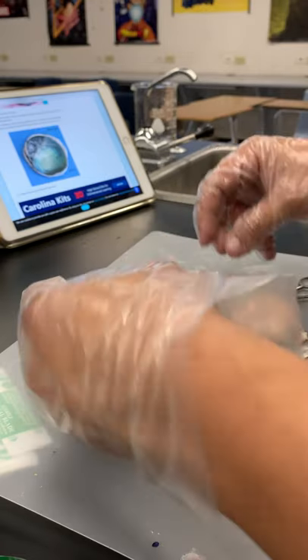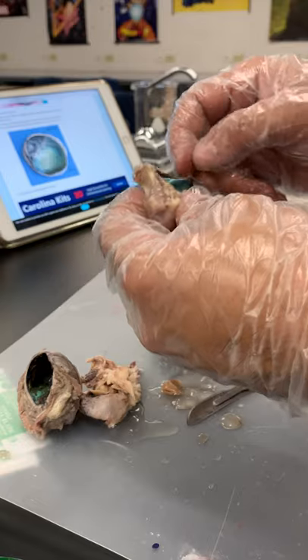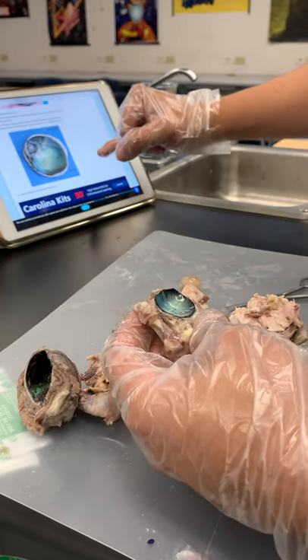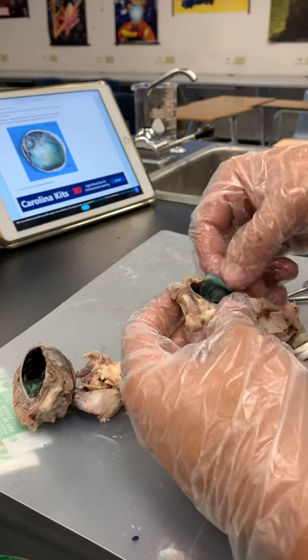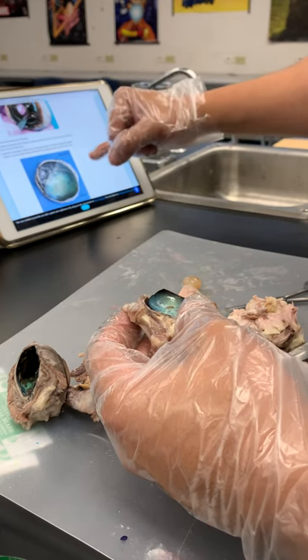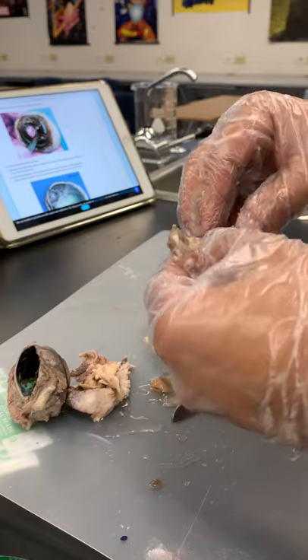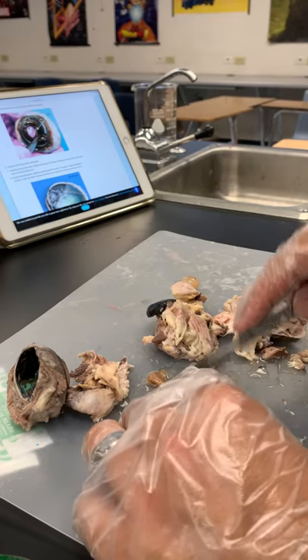Kind of a little blind spot — you can see it gives the color, the pigmentation. Pull that retina out. It reflects what we have — remember the color of the eye reflects what you have in the back. There's an iridescent reflective layer beneath the retina — this is the tapetum lucidum right here. We don't have it but they do — a little reflective layer in the back of the eye. Maybe we can slice this a little more, but here we can see the attachment on that little nerve. Trying to slice it a little bit more just to get into the structure.